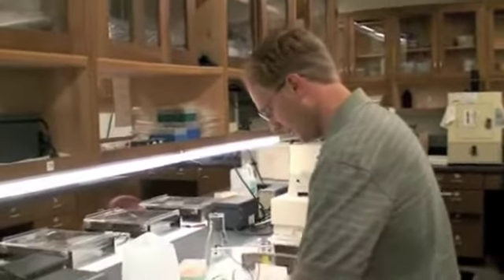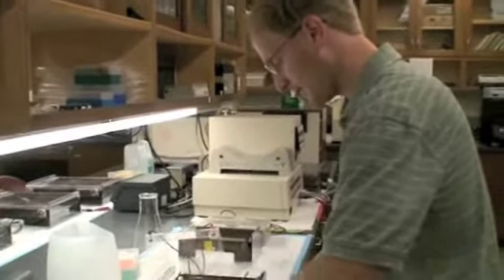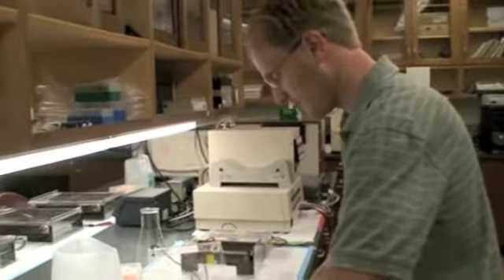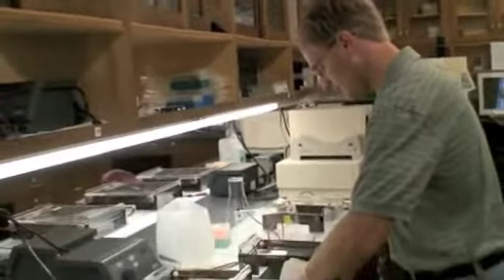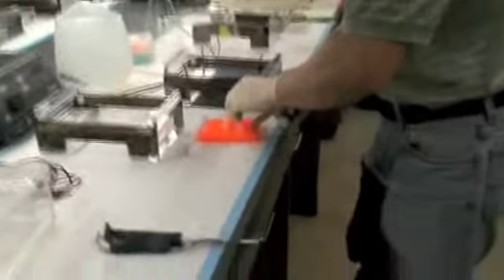Now, in general, it shouldn't take me that long to load. I know it won't take me that long. It might take you guys the first time through a little while to load your samples. I'm trying to show you some of the tricks.